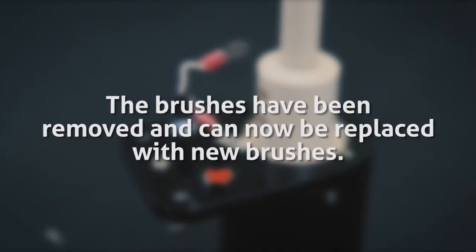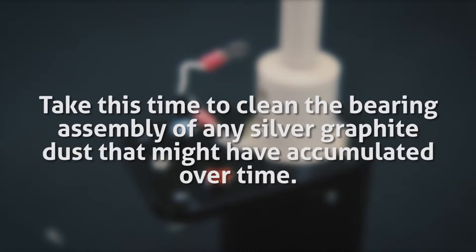At this point, the two brushes have been removed from the bearing assembly and are ready to be replaced with new brushes. You can also take this moment to clean the bearing assembly of any silver graphite dust that might have accumulated over time.